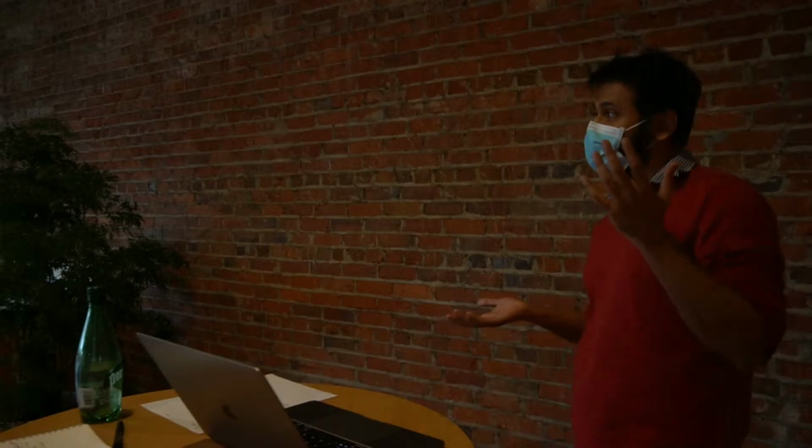And Paul has developed an app that is specifically designed to work with count data, so any kind of count data, not just RNA-Seq, and he'll give us a tour of it. It's a Shiny interface, so you can just upload your data set and do things a lot more quickly and easily than you can in R. So that's really it for today. I have a little bit of quote-unquote bonus material for the stats fans. But before I move on to that bit, does anyone have any questions?